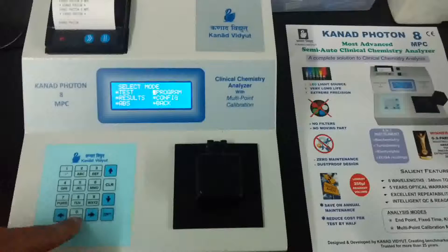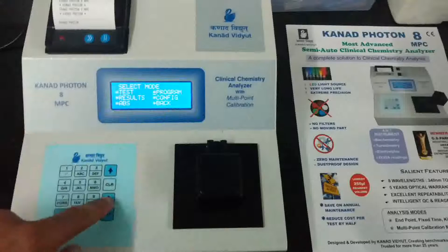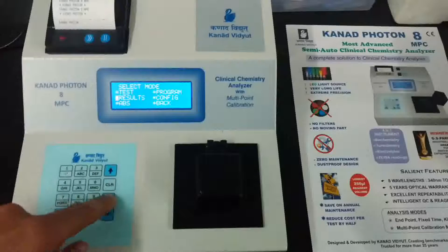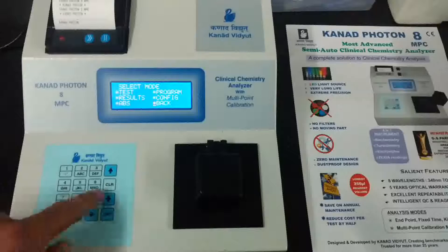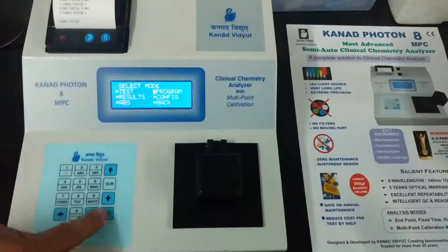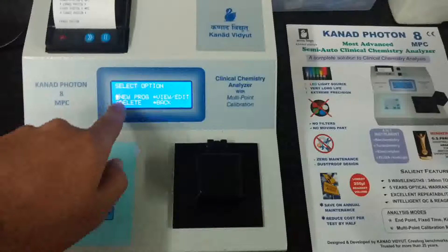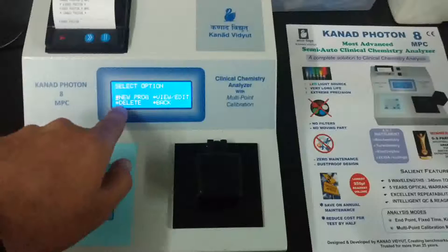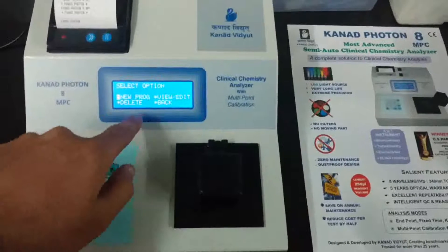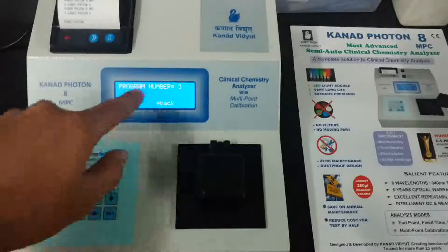Using the arrow keys, I am changing the cursor from test to program. There is also a configuration mode, results mode, absorbance mode, and back. We will first go to programming. The cursor is positioned there, so press Enter. Now select option — this shows new program, view, edit, or delete programs. We will select new program and press Enter.